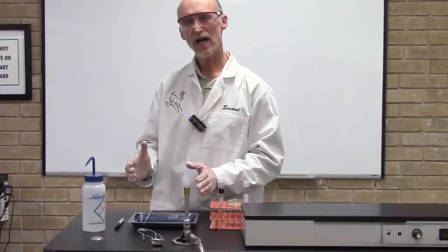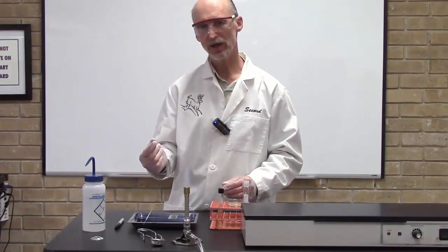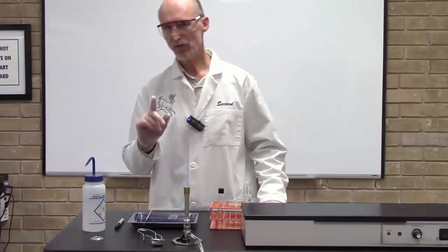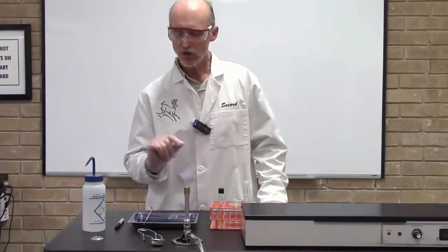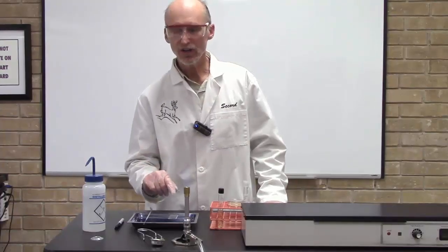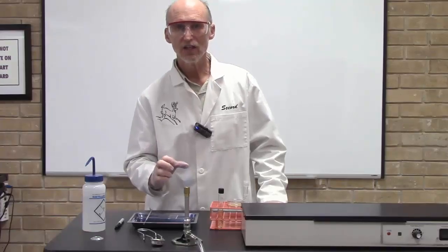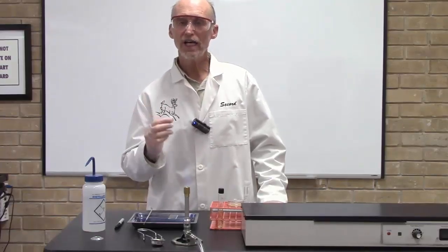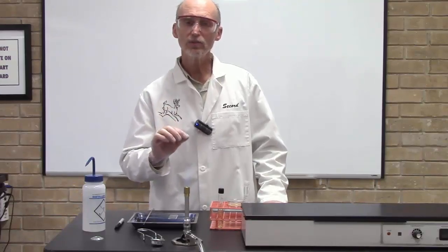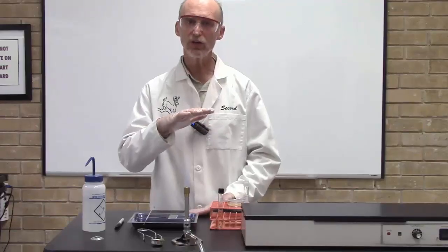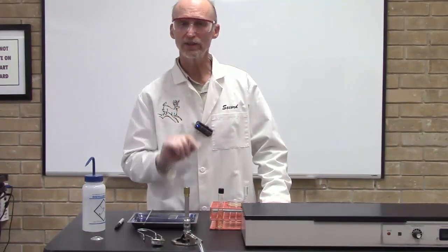Now let's look at some common mistakes that are often made by students when they perform a bacterial smear. The first mistake is to get way too much bacteria. You should never see clumps of agar in a bacterial smear. You shouldn't see a big wad of bacteria. Just be delicate. Go in with your inoculating loop and just take a little bit of culture. You don't want those bacteria stacked up 20 and 30 thick. You want a nice even layer of them. So that's the first mistake.